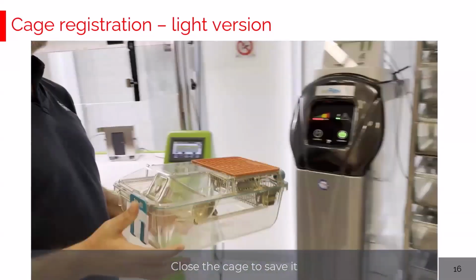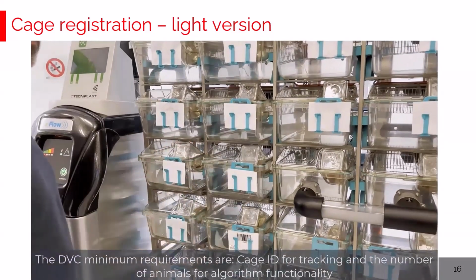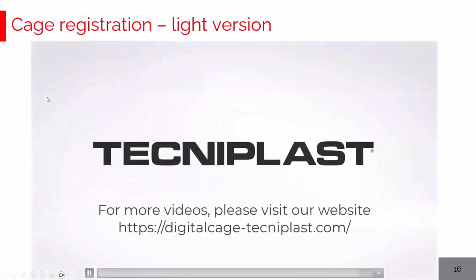These are the mandatory information for the DVC to run properly in terms of algorithm and in terms of data collection.